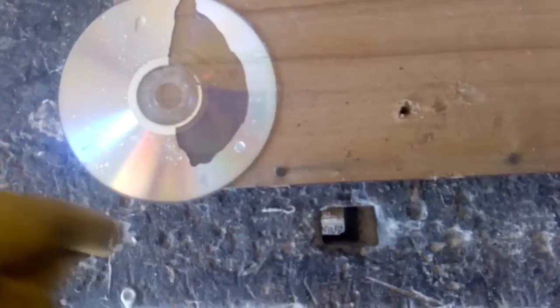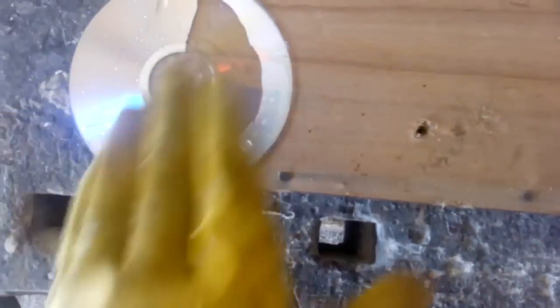This is nothing staying on the disc. Just a little spot like here, but never mind. What we got here is a couple of discs. That didn't work. Silver is stripped on that place, but it stays on the disc because we got still some little foils which protect the silver.